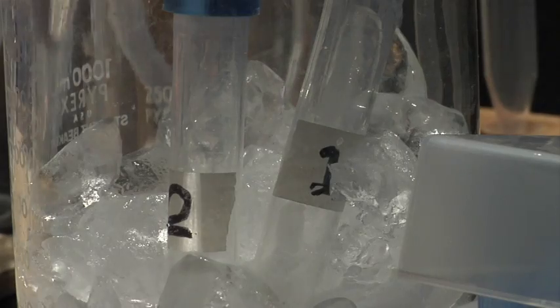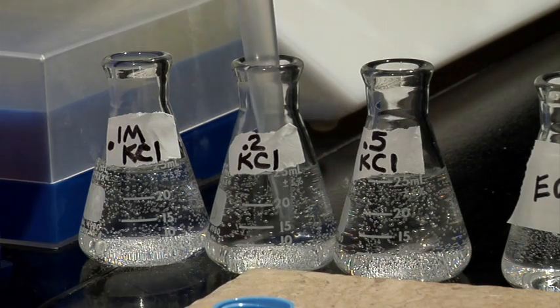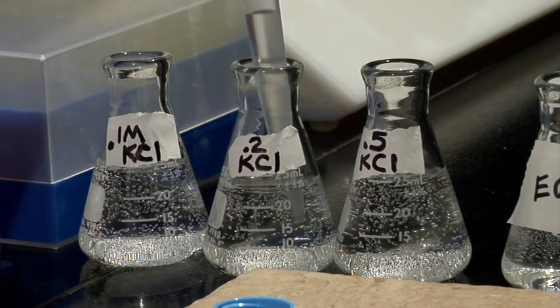Continue this process for the rest of the tubes using 0.2 molar solution for tubes five and six, and 0.5 molar solution for tubes seven and eight.